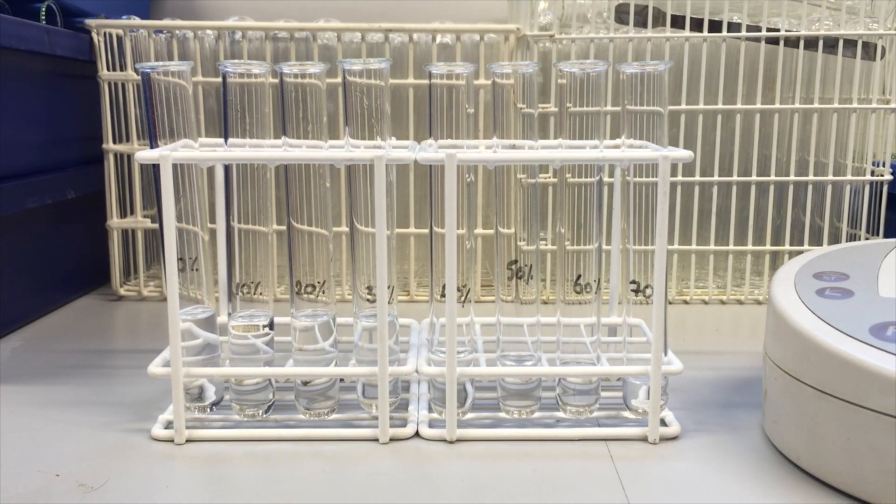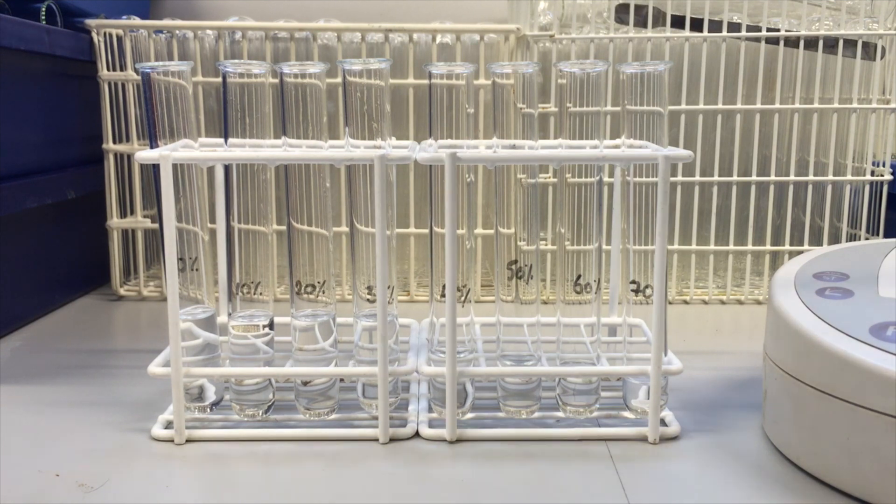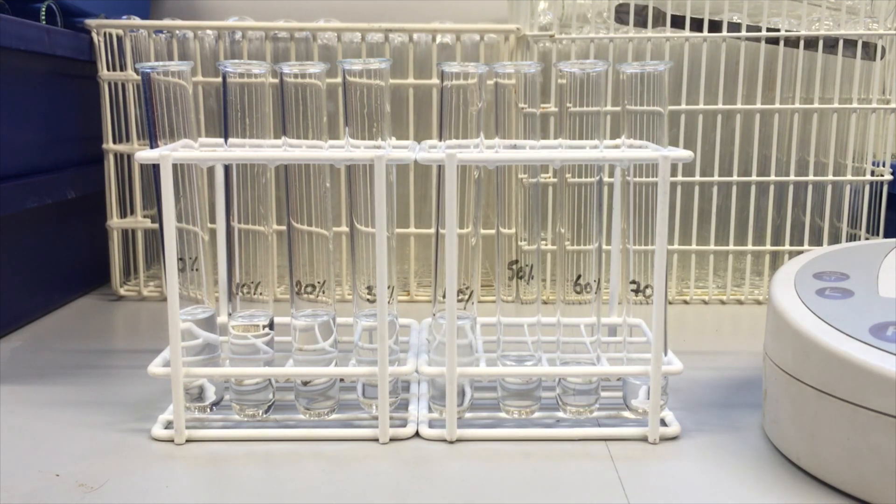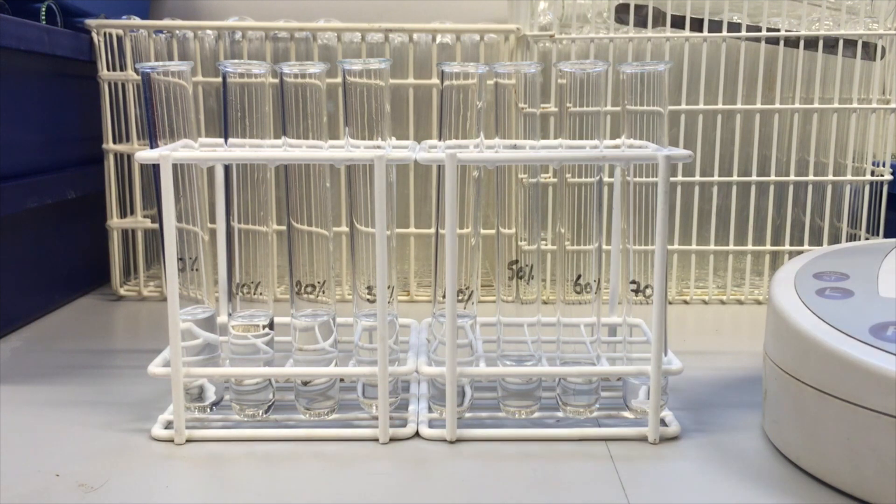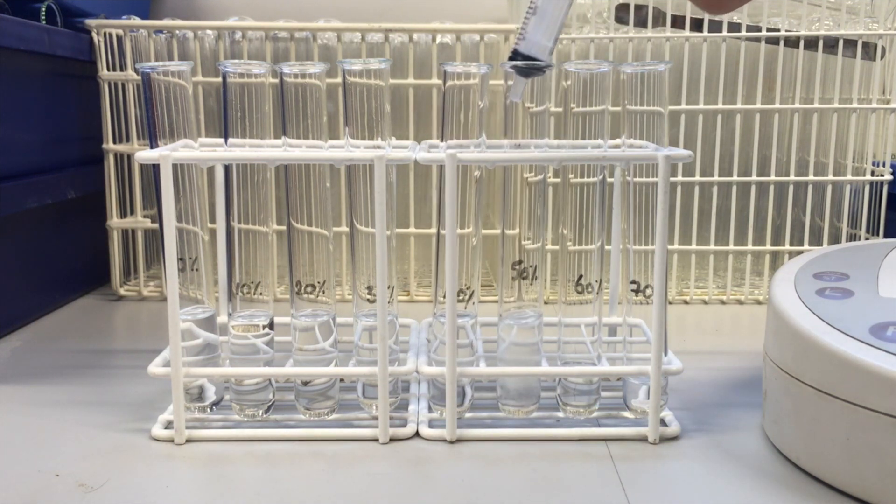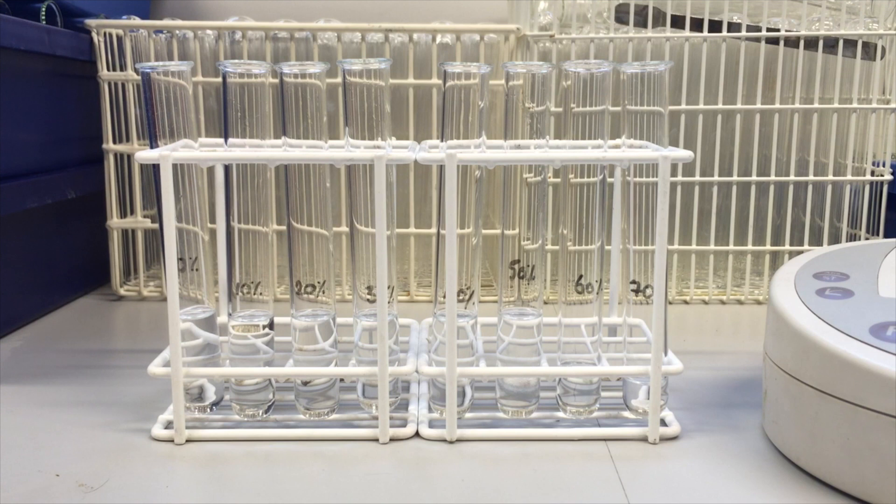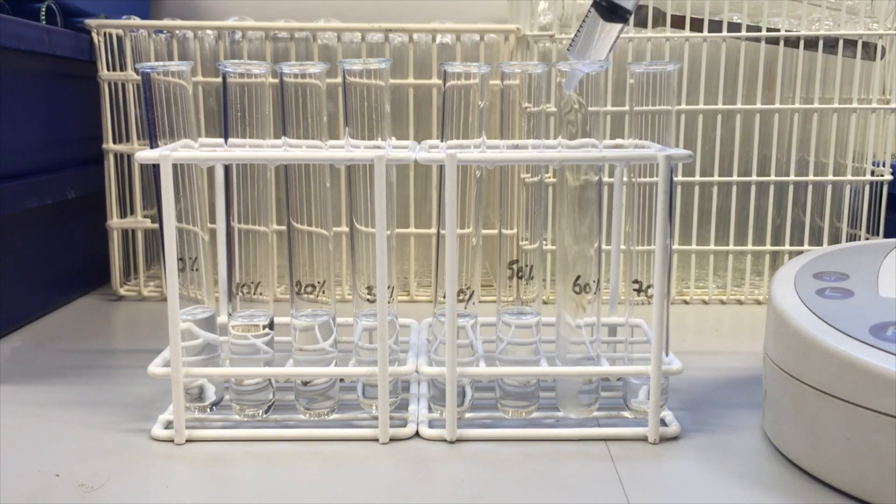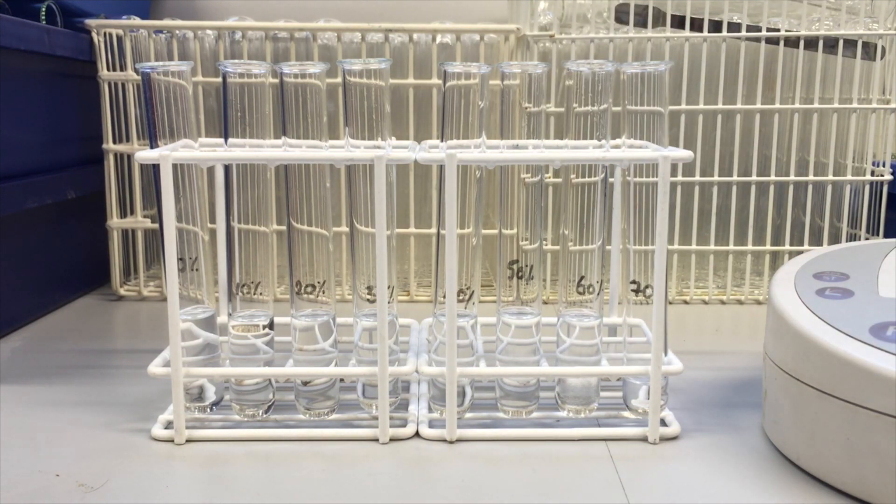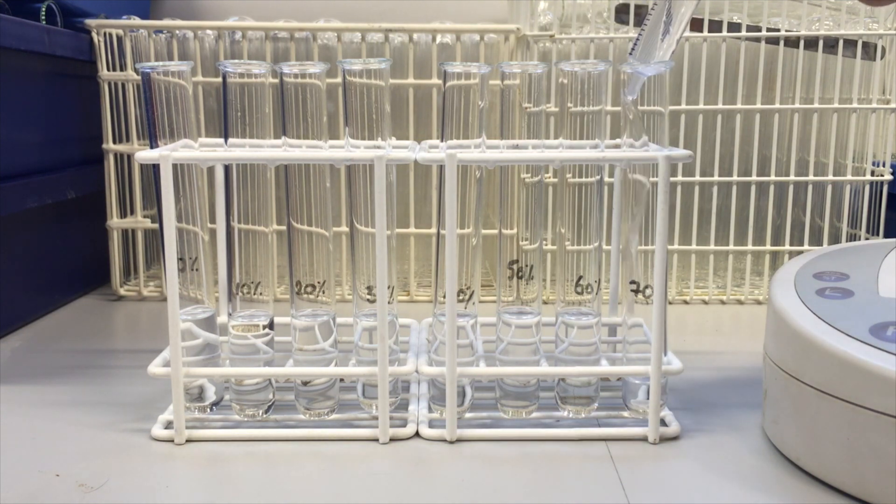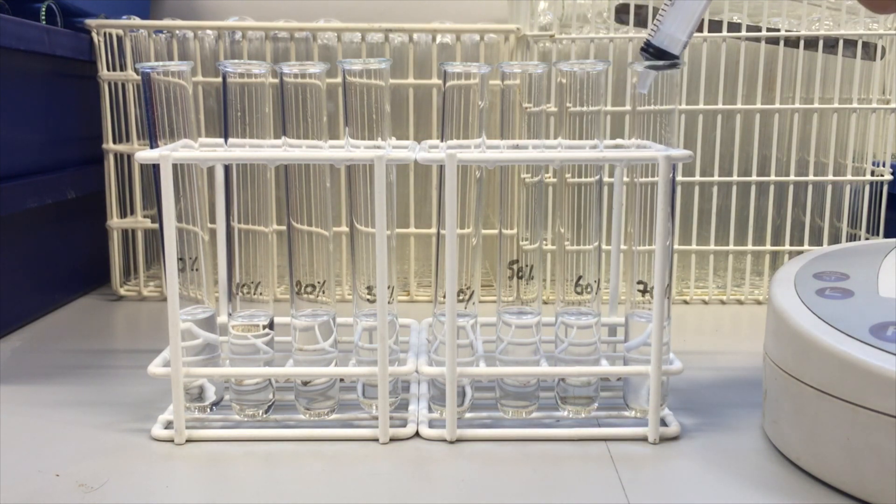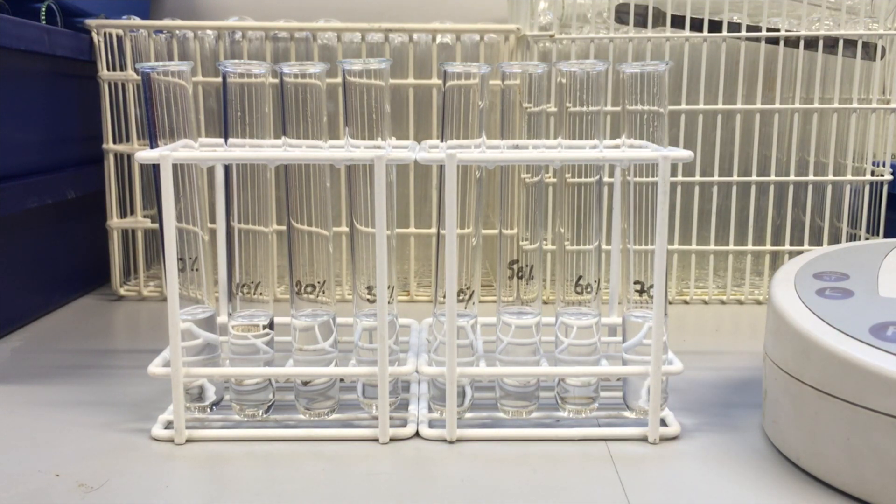You should see where this is going to go eventually. The highest concentration is going to be 70. And the final volume of all of them should be the same. 2.5 for 50. 3 cm cubed for the final alcohol concentration of 60% and finally, 3.5 for the 70%. And that should be that.